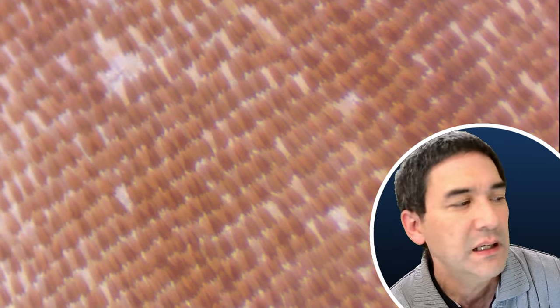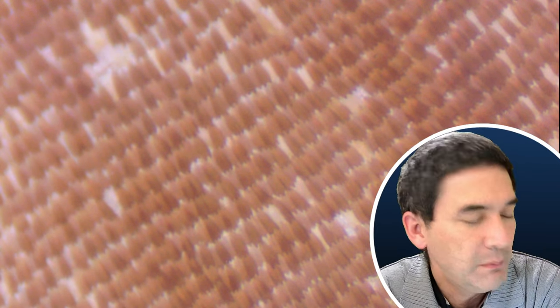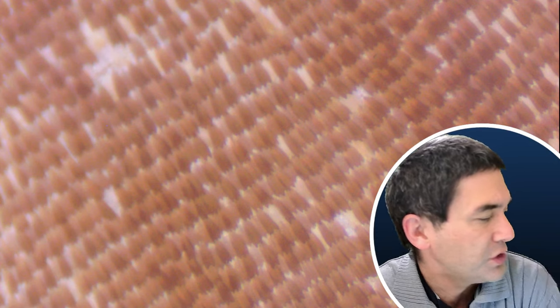You would probably need to take out the butterfly to improve quality. Let's try the other sample — always start at low magnification. Here we are — we're able to see the individual scales much better. Occasionally you can find butterfly or moth scales in dust. But I'm really not happy with the quality, partly because the glass is curved, which contributes to the reflections.